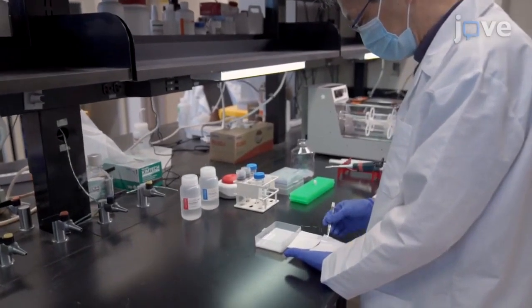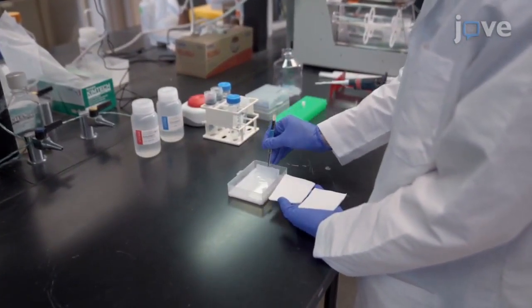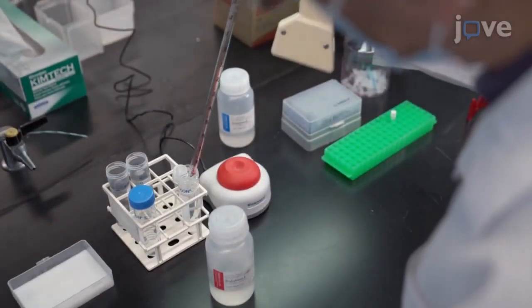Begin by incubating the PVDF membranes in appropriate blocking buffers for one hour with agitation at room temperature. While the membranes are incubating, prepare the solutions.